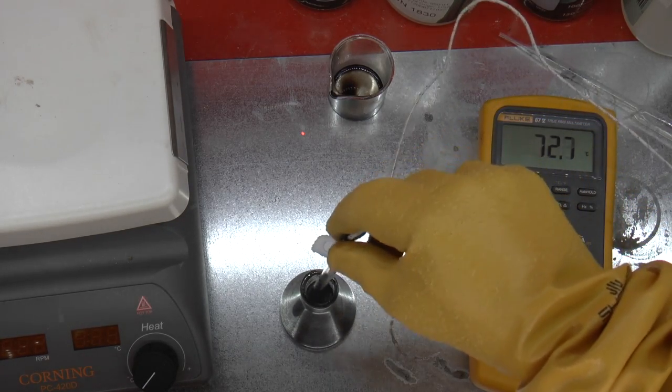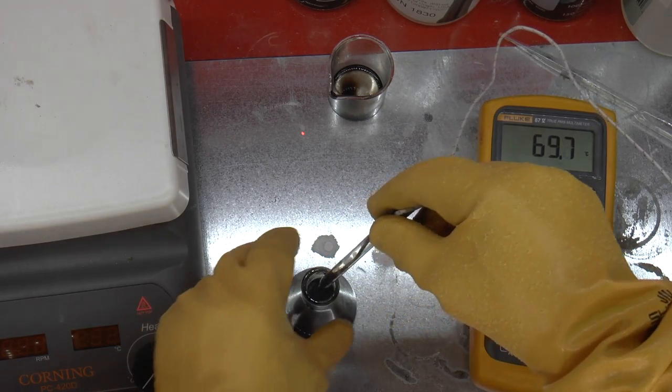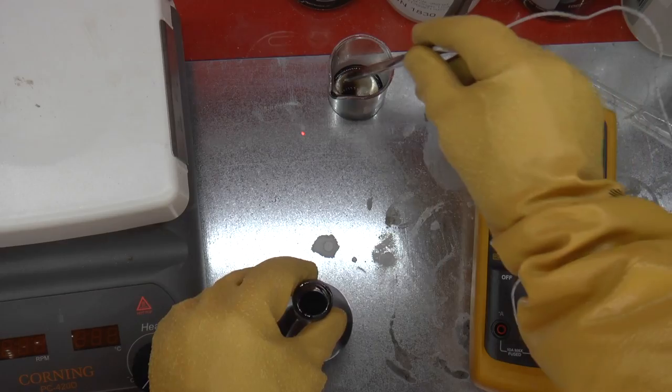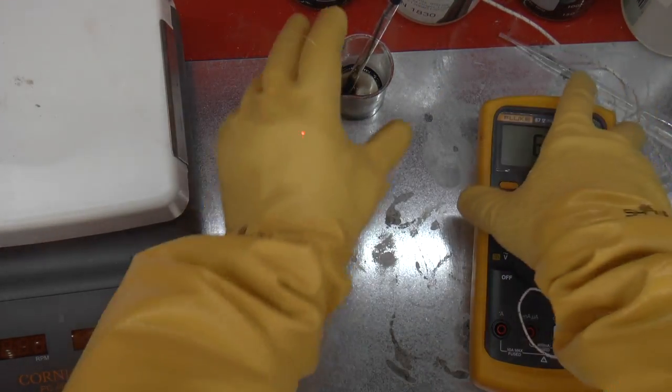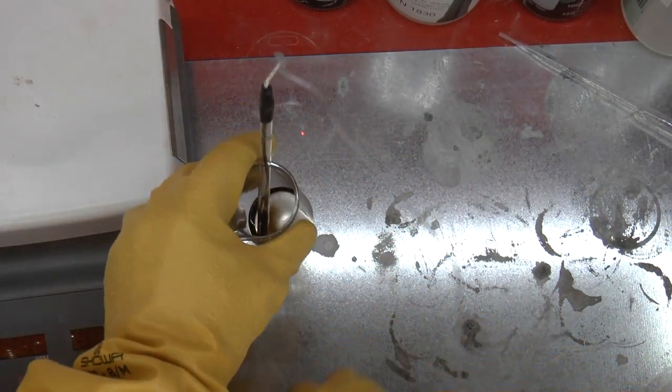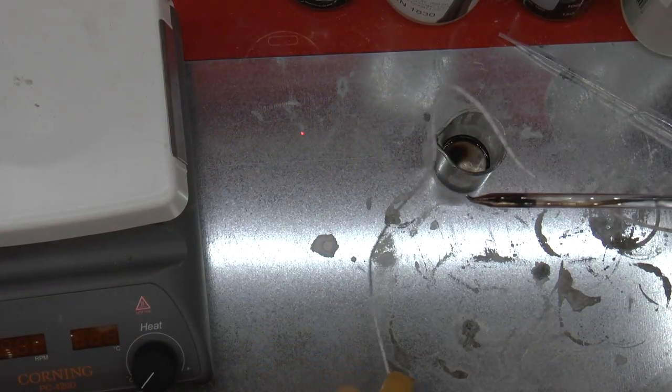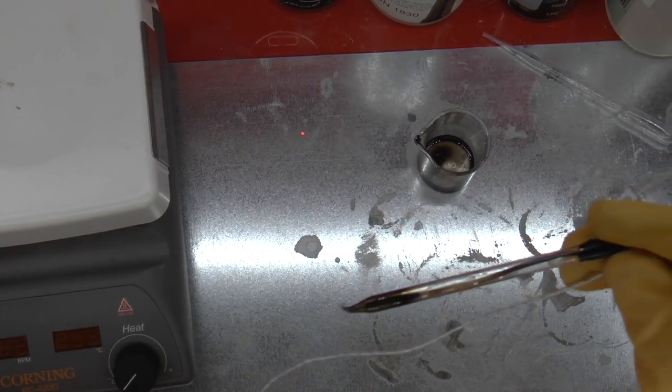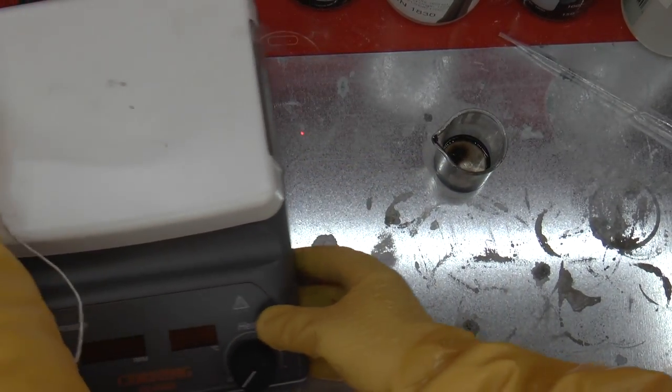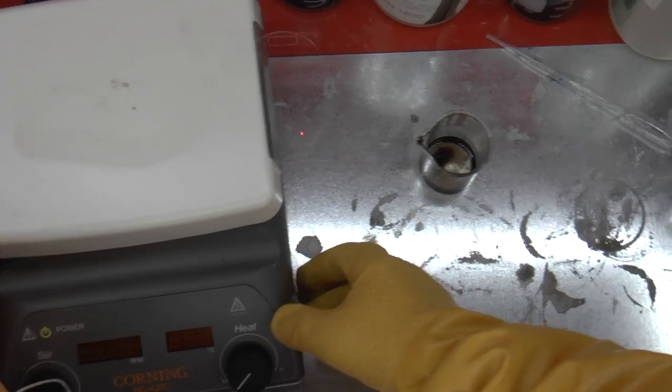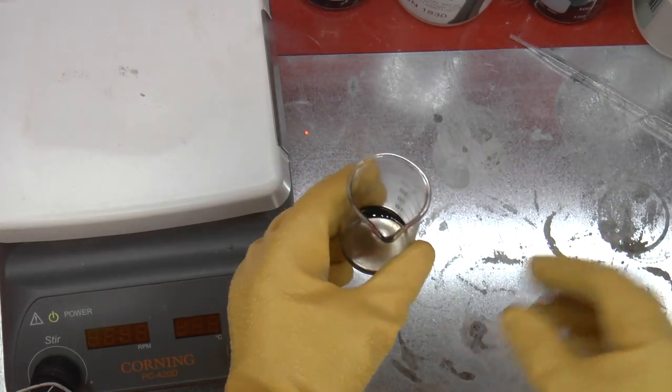Take the dirty thermometer out and get all those drops off. Put it in that beaker temporarily and set this aside. Now it's a little bit cramped in my fume chamber, so I'm a little bit careful about how I maneuver and where I put things. Bear with me while I shift things around.